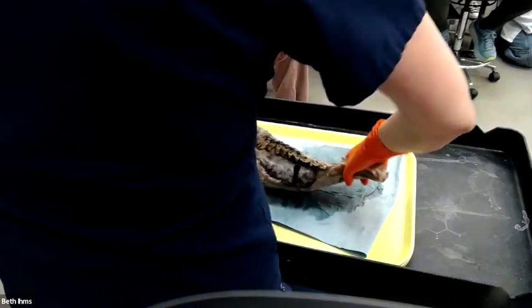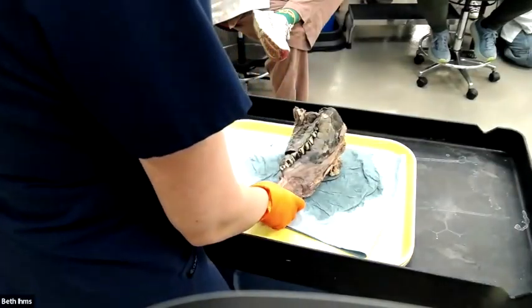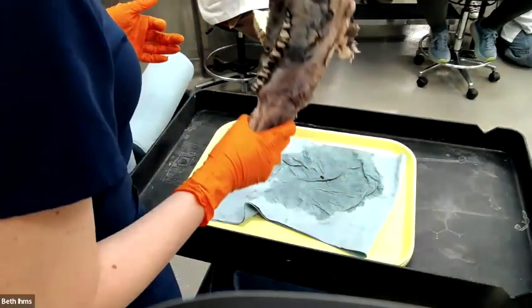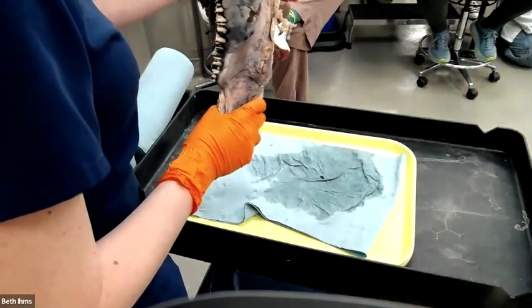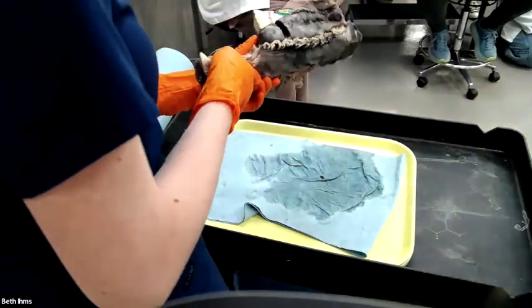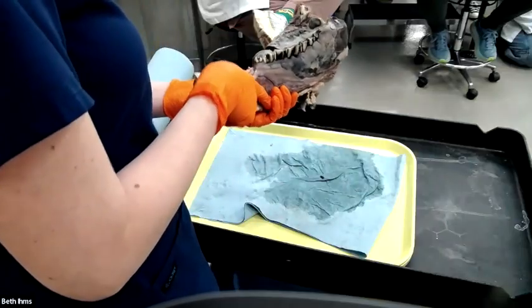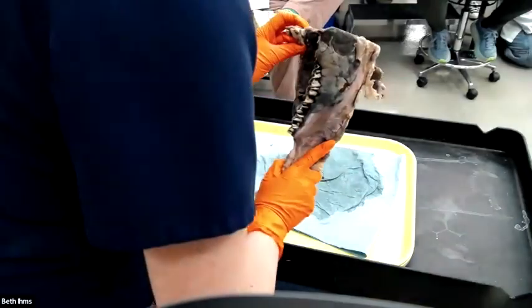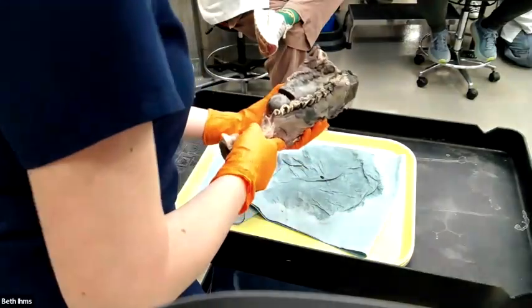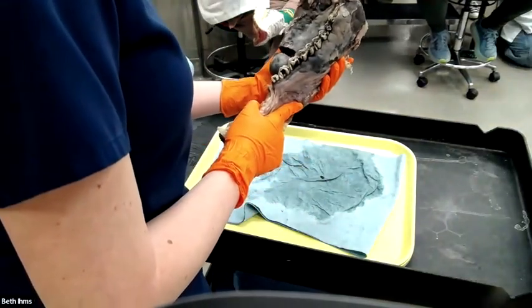Oh, I love this one. All right, so this is a cow jaw. Can someone bring me the normal jaw that we had too? Because I think people kind of struggled with this one. So this is a jaw. We have removed almost all of the muscle. This is mostly just bone and mass left. There's a little bit of muscle right here that we couldn't get off, but this is mostly just bone.